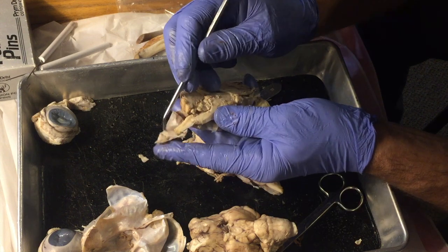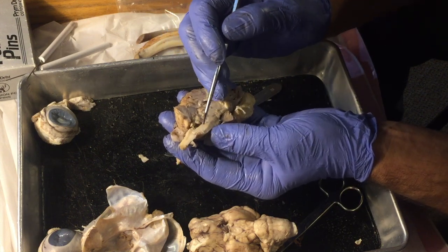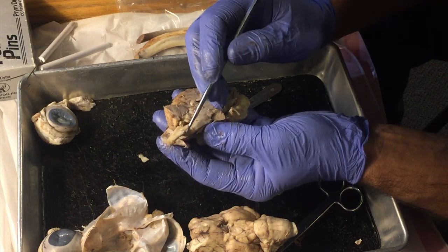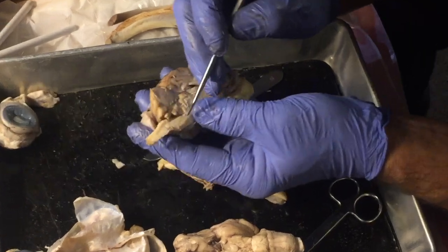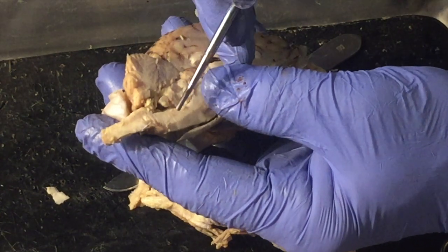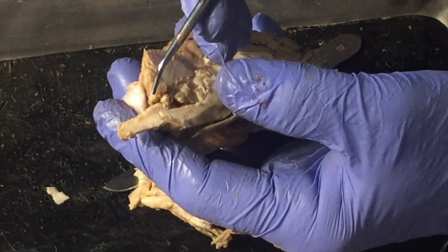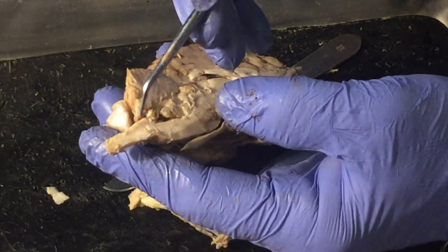Okay, folks, I remember one last thing I wanted to mention. Right here, the medulla oblongata, which connects the brain to the spinal cord, this is where centers for breathing and heartbeat are maintained. And so a short distance down the spinal cord, those nerves that control those things exit the spinal cord and go to your diaphragm, to your rib cage, to your heart.